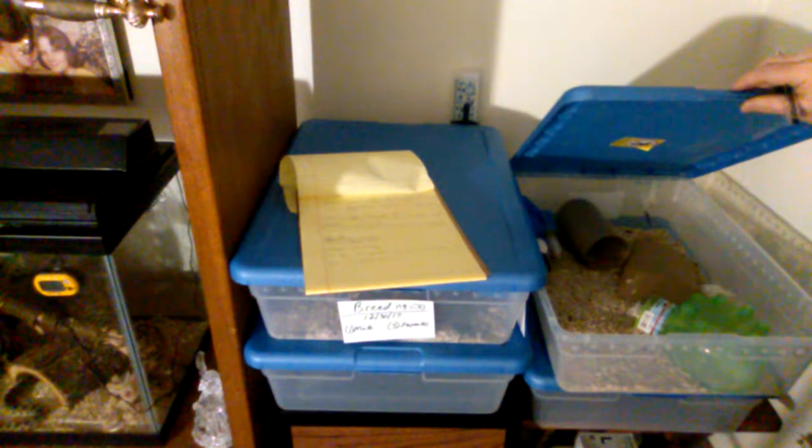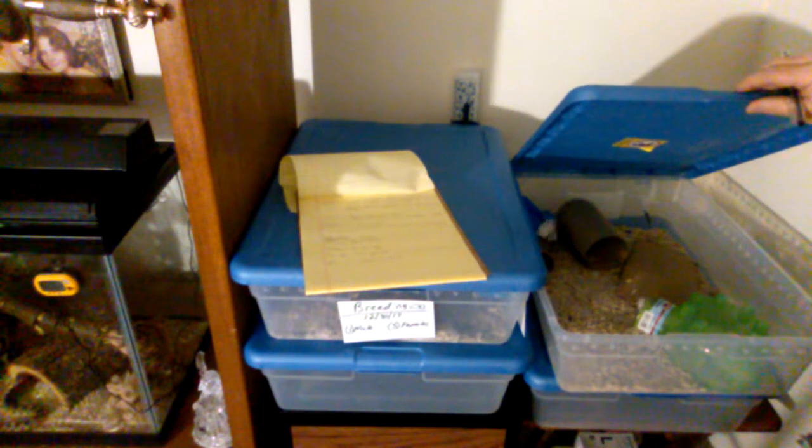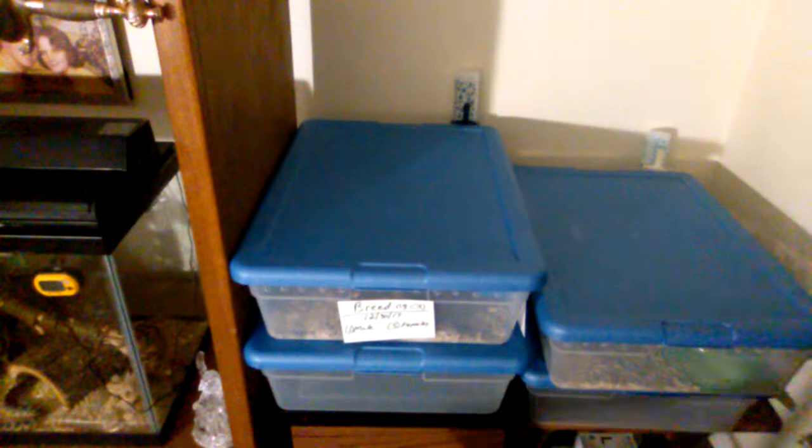Again, no signs of aggression, no fighting, no mating that I've seen, and no signs of nesting. The exact same setup with the aspen bedding and the baking soda, the water bottles — all the same. So this was $30 and this was $30. We're starting out with two cages just in case we have any deaths, and to increase the amount of breeding.